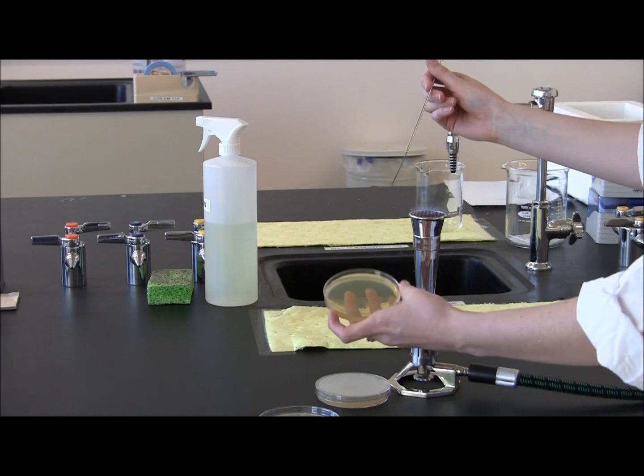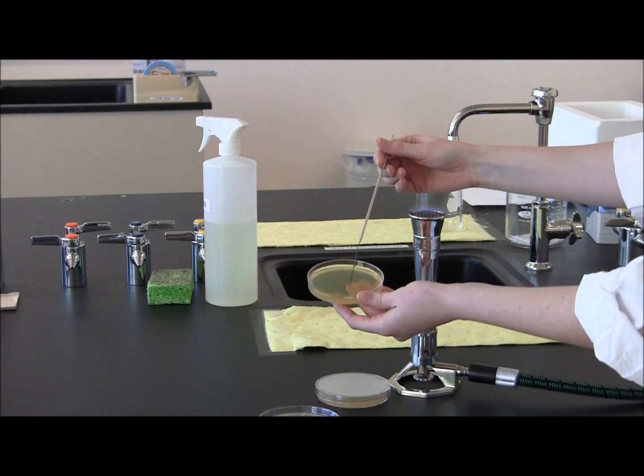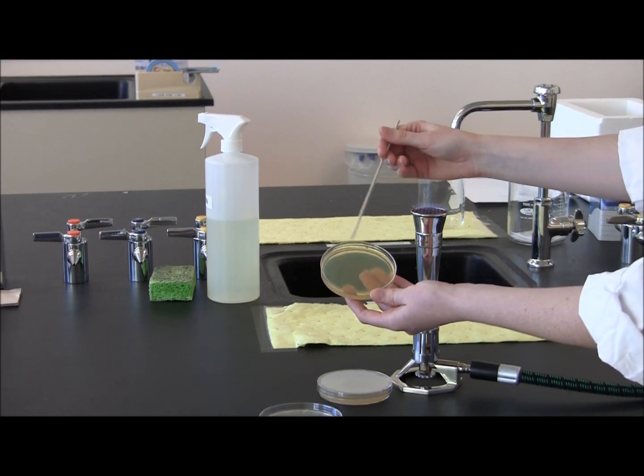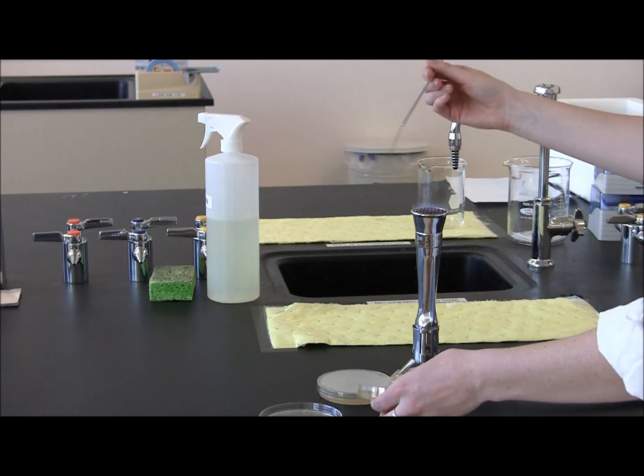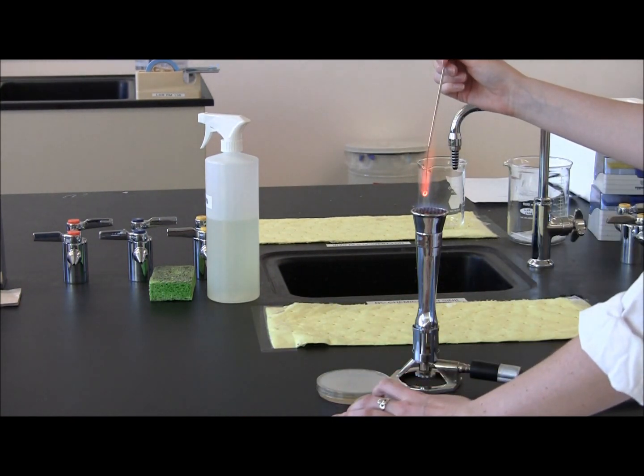Moving on to your third streak. Again, replace the cover and flame the loop until it is red hot.